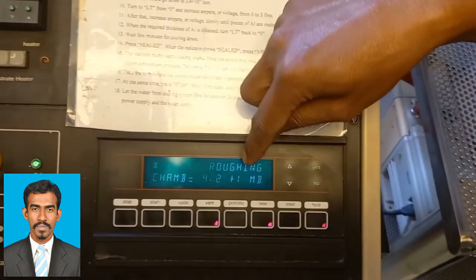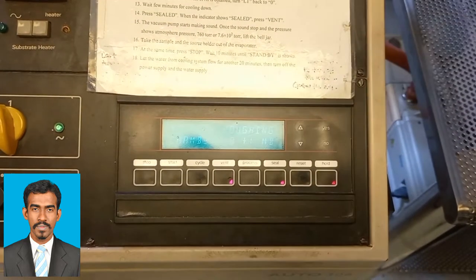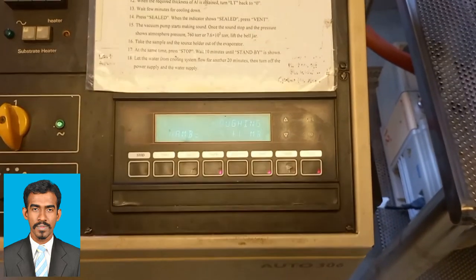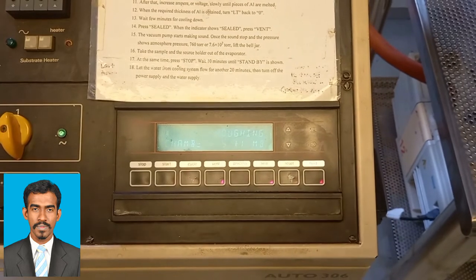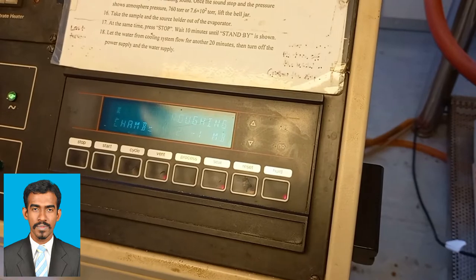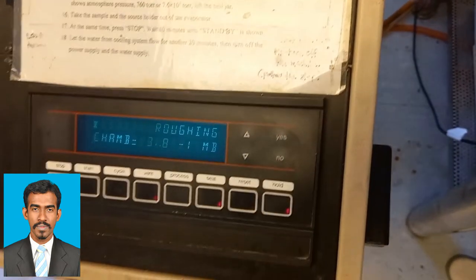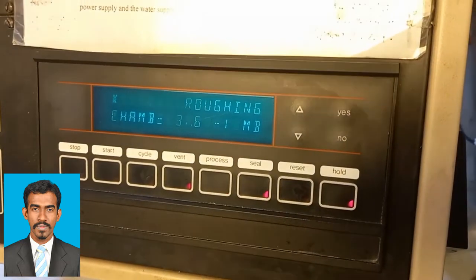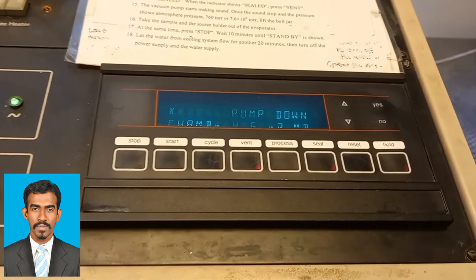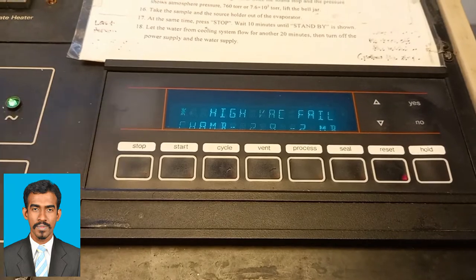After roughing we go for cycling again. As I press the cycling button, the system will take some time for the thermal evaporation — we will wait for almost 40 to 45 minutes. During this time the pump will go up and down more than 3 or 4 times.